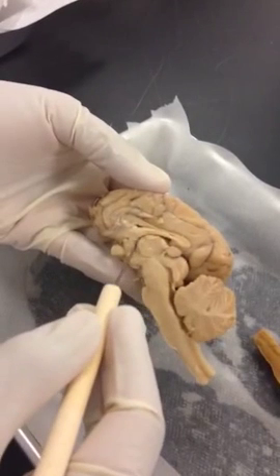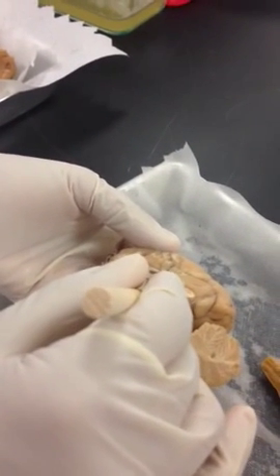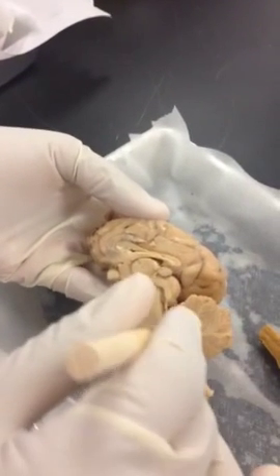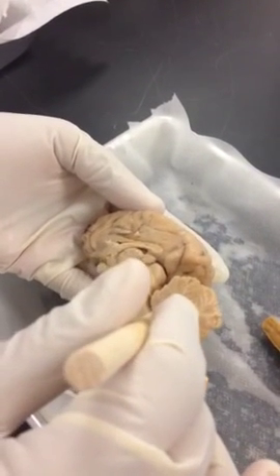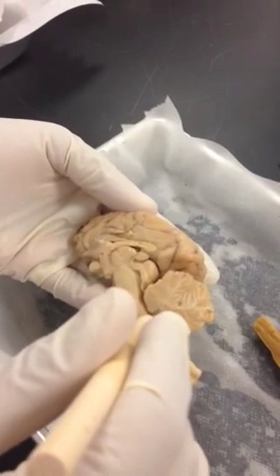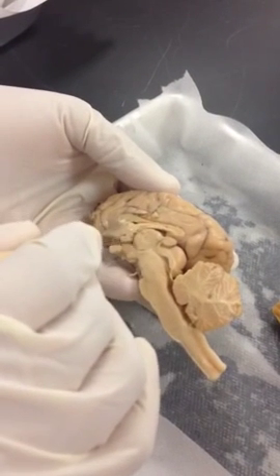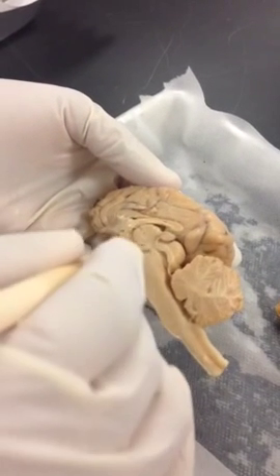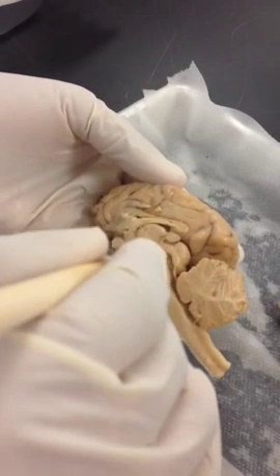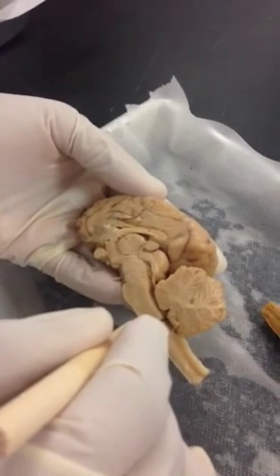See, it's so thin and narrow, but I can pass the needle around. Can you see that? And then this is going to be your fourth ventricle, that's between the medulla and the cerebellum. And you can see a little wedge, a V-shaped wedge. Okay, and connecting the third ventricle to the fourth ventricle is a passage. We call that cerebral aqueduct.